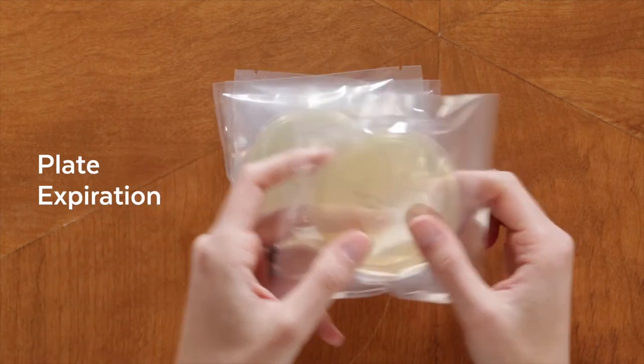Also, if you've ordered them, pencil-sized swabs are used for sampling suspected visible mold. Note that sampling plates have an expiration date, so be sure to use them before they expire.